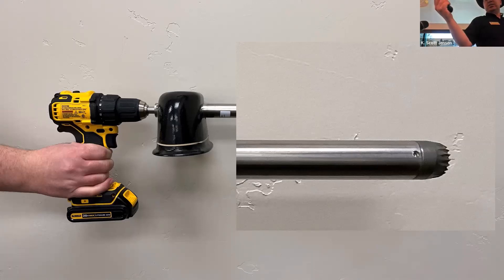As the sample goes into the probe it collects into the black tote. I always put a zip-lock bag right under mine, so after I take my sample everything goes straight into the bag — I seal it up, write what the sample identification is, and it's ready to send in.